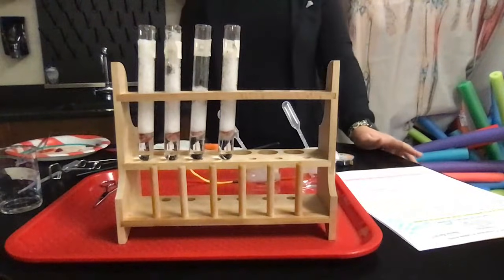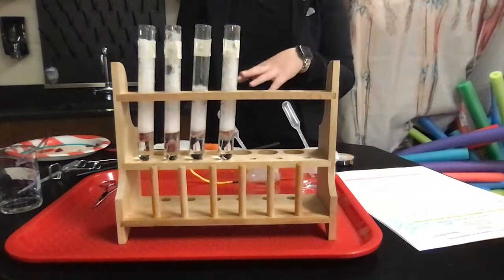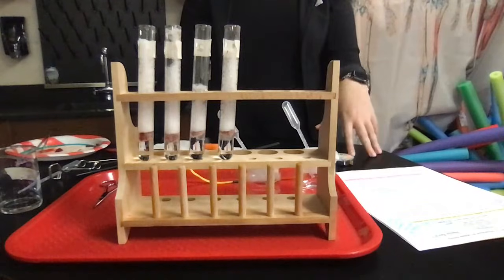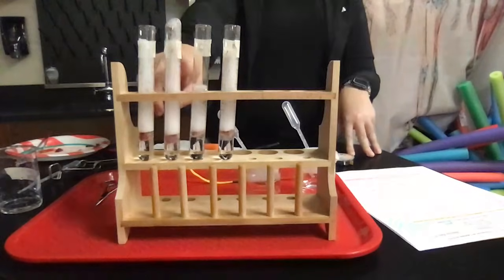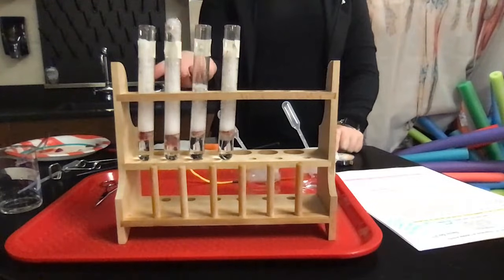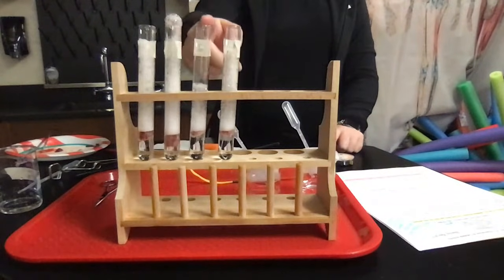Let's think about it. In your body, you have certain organs that have higher acidity, higher alkalinity, but a lot of the tissues and organs have a neutral pH. So the 3 here, see it's still going. That one was about a pH of around 8, which is very close to neutral. So that one has the best reactivity, which makes sense. The others, this was pretty basic. This one was pretty acidic, but not the strongest acid. The strongest acid definitely was not an optimal environment.